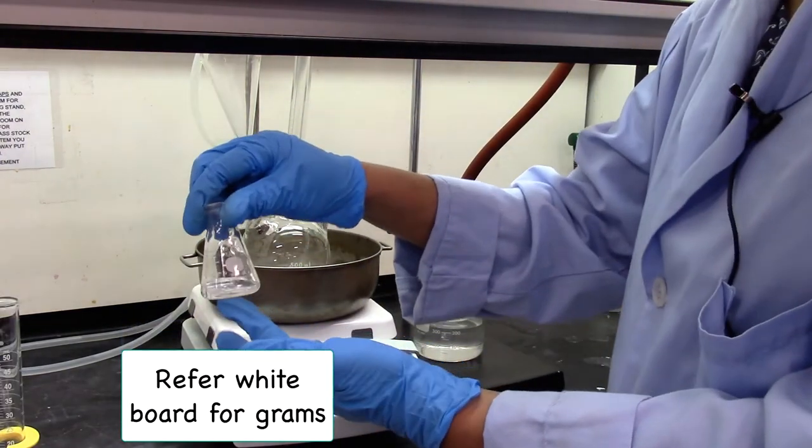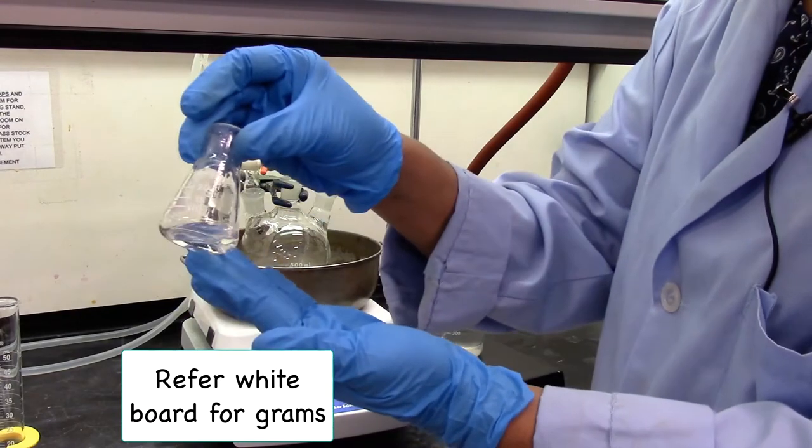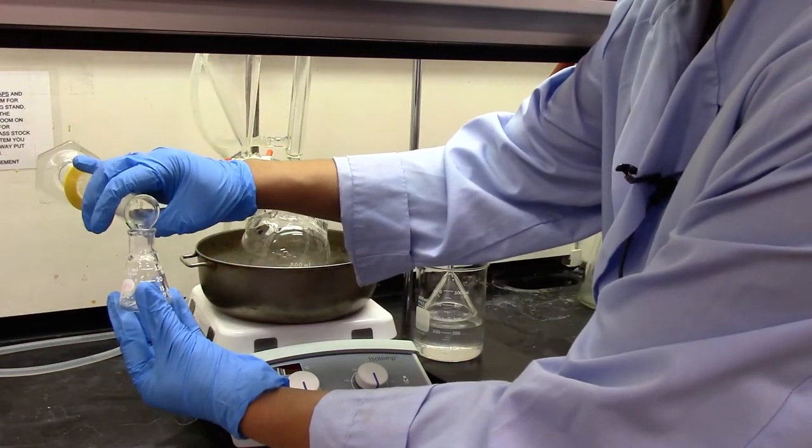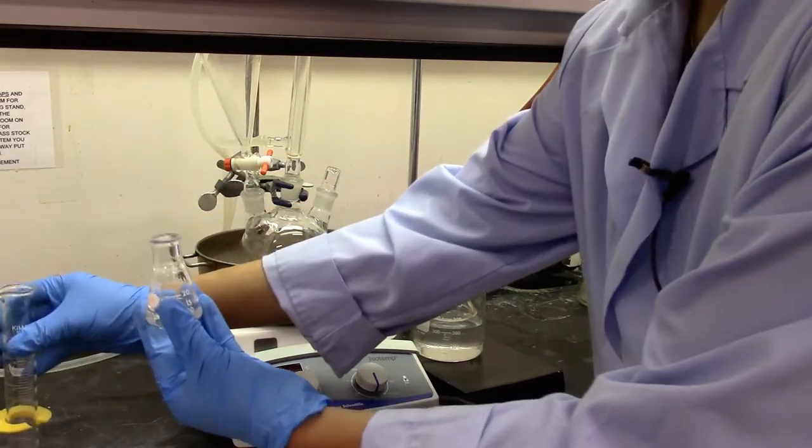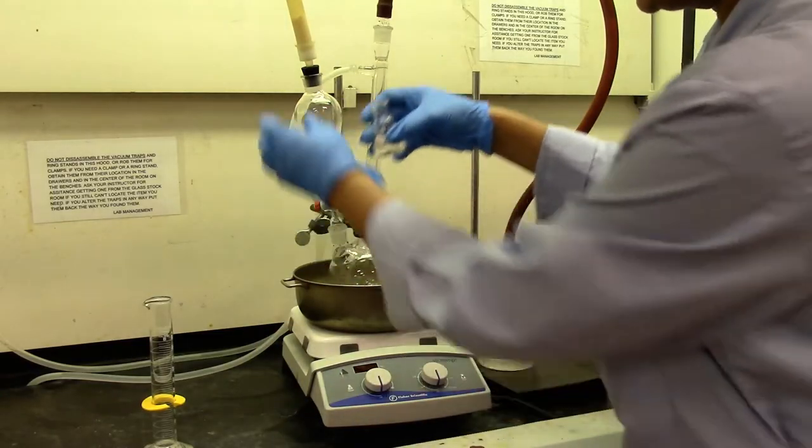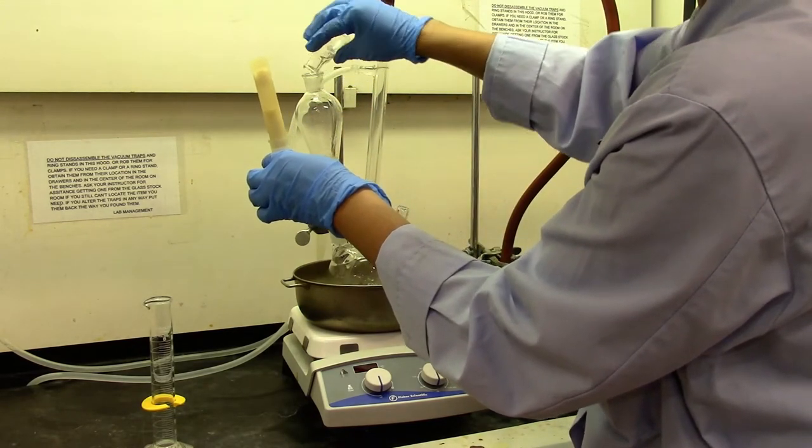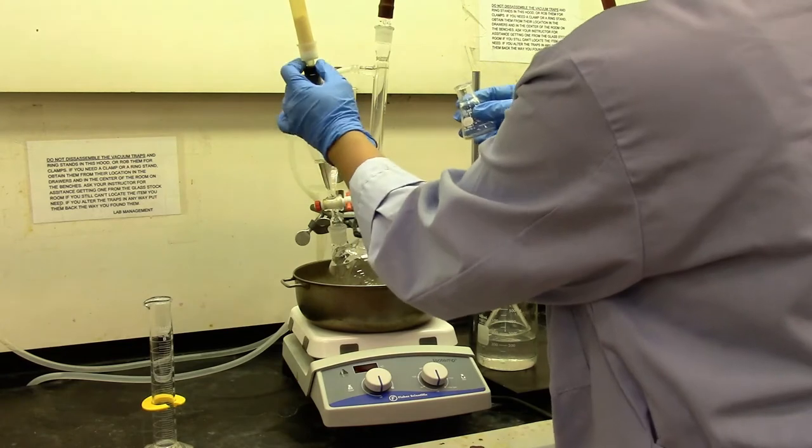Here's my 4.7 grams of acetyl chloride. It's a liquid. I'm going to add 8 mL of dichloromethane. So I'm going to transfer this acetyl chloride dichloromethane mixture into the separatory funnel. And replace the drying tube immediately.